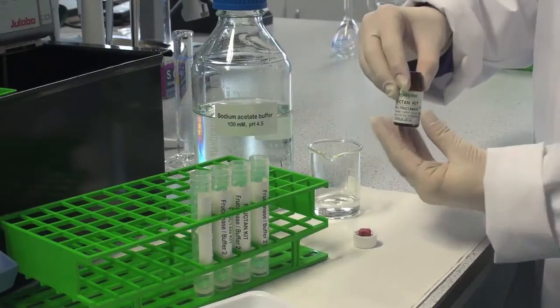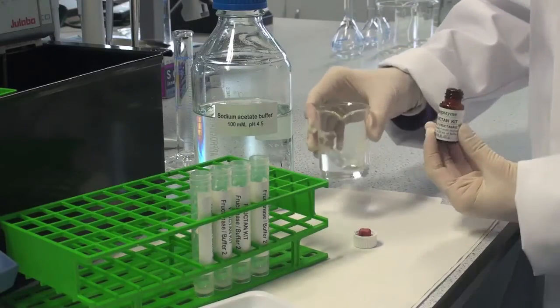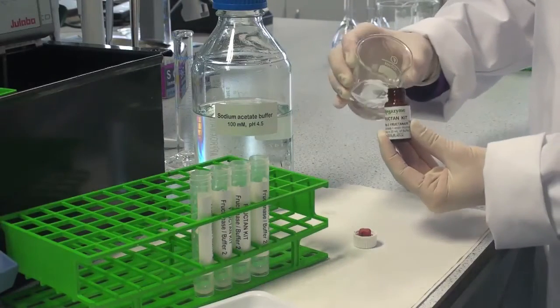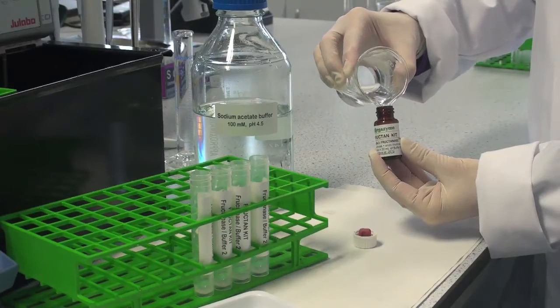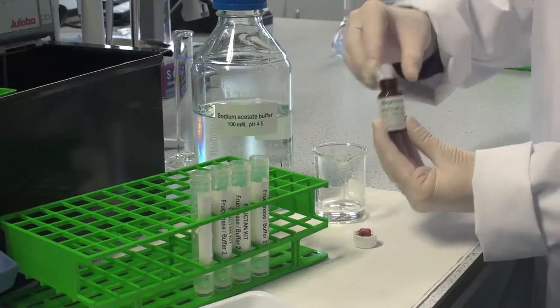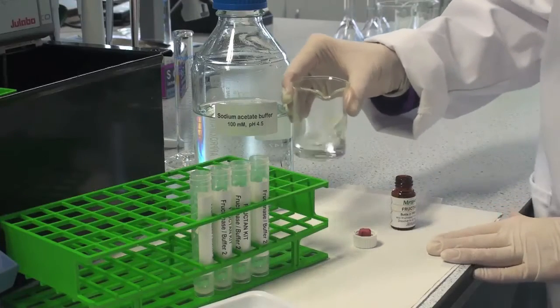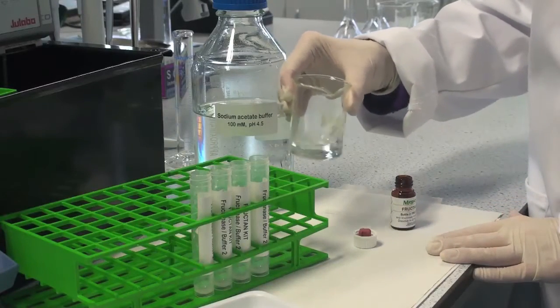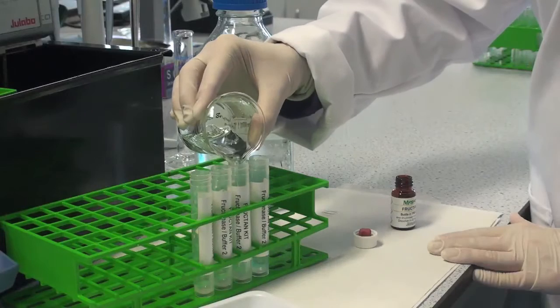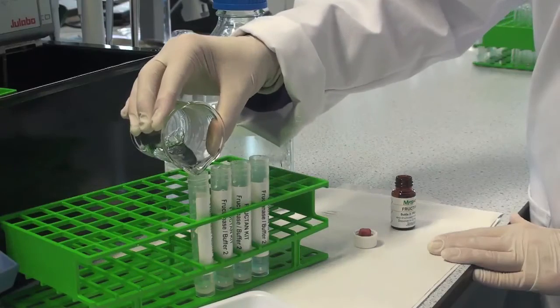Take care to completely dissolve all of the fructanase enzyme mixture in the vial. Divide this enzyme solution into aliquots of appropriate volume and store at minus 20 degrees centigrade. This enzyme is stable in polypropylene containers for greater than 5 years at minus 20 degrees centigrade.